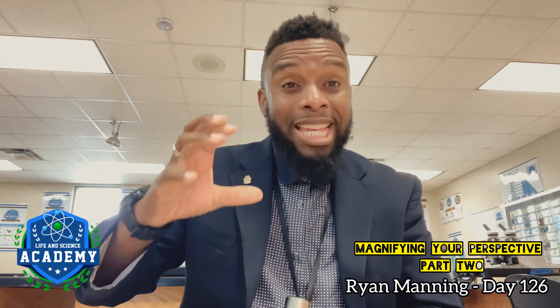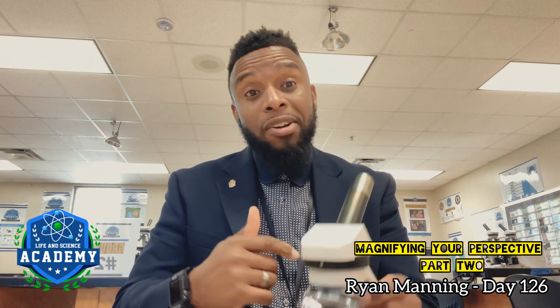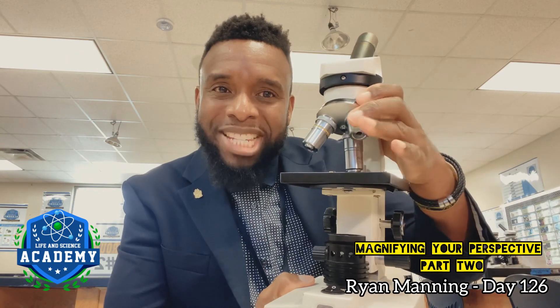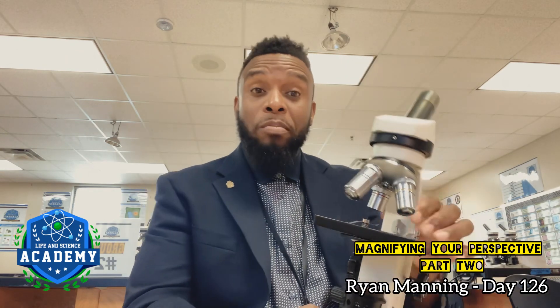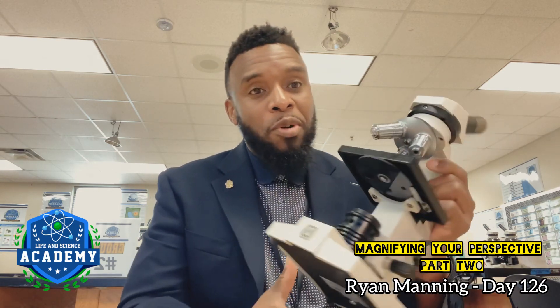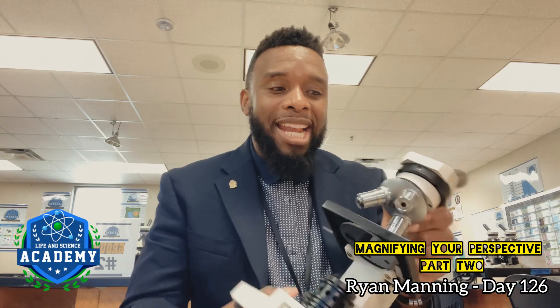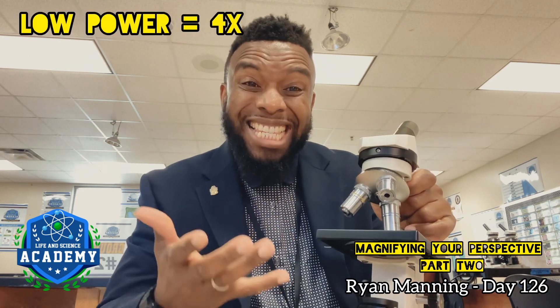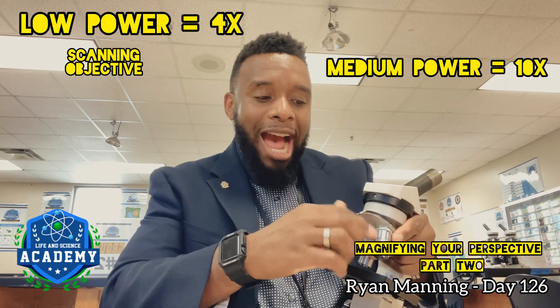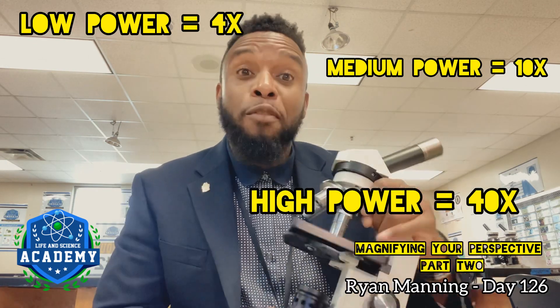So it's going to really zoom in, get some details. But then in my last video, I also mentioned these right here — these are known as objectives. They also magnify the specimen on the stage of the microscope. This specific microscope has three objectives: the low power one known as the scanning, the medium power, and the high power objective, which magnifies something 40 times.